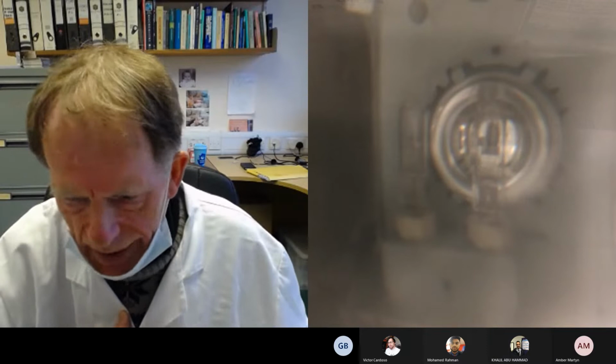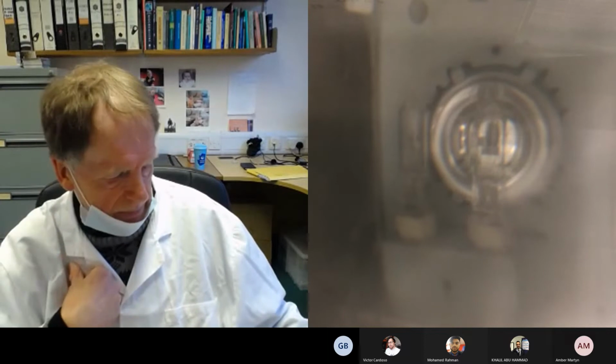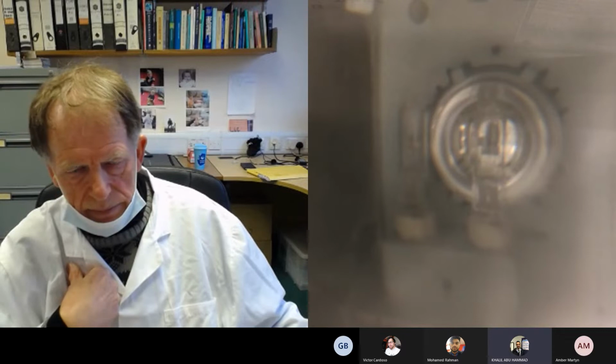So we can't use the 2.6 value because it's beyond the Lambert-Beer range. That's why we diluted by a factor of 11, to bring it within the Lambert-Beer law. All those 3 readings, around 0.6 or 0.5, are within the range. Yeah, I got it. Thank you, Steve.